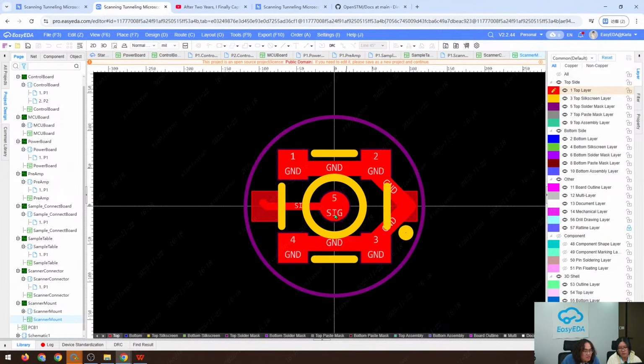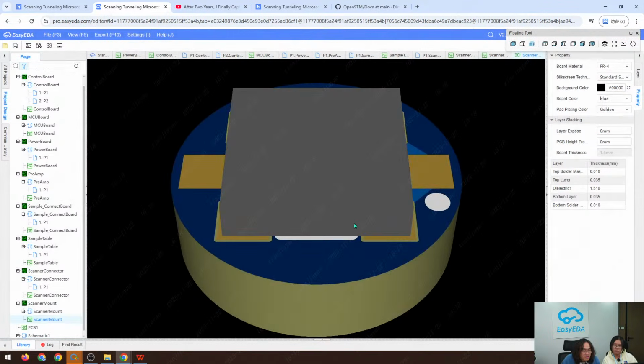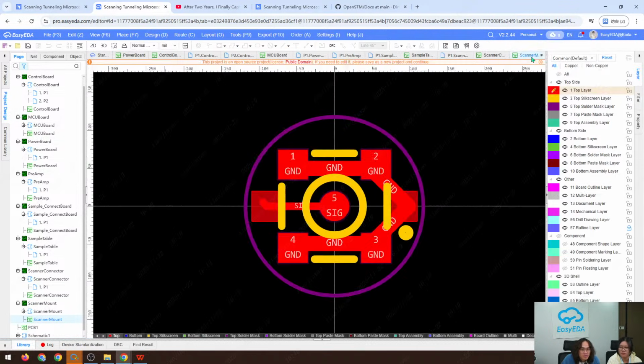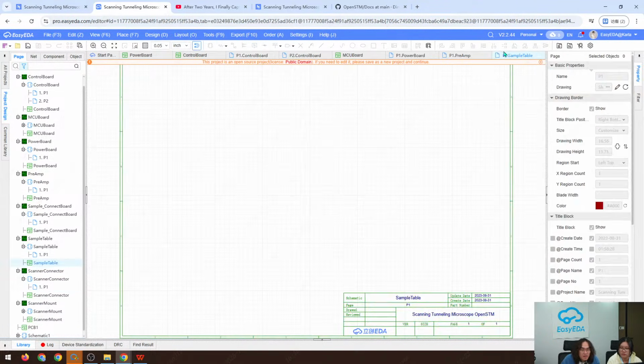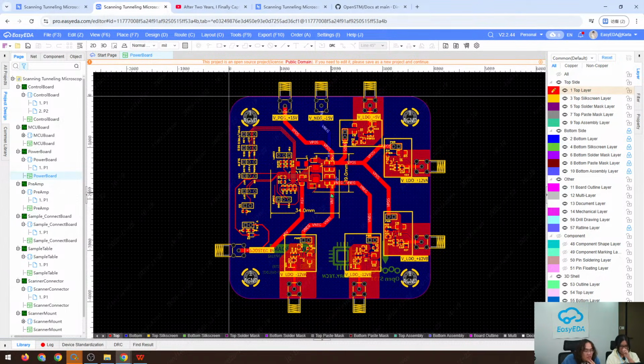And this is like a tip holder. Actually, we will solder an MMCX socket here, and then we can insert a tip into the MMCX socket. So let's take a look at how we can draw this power board here. Just this one.